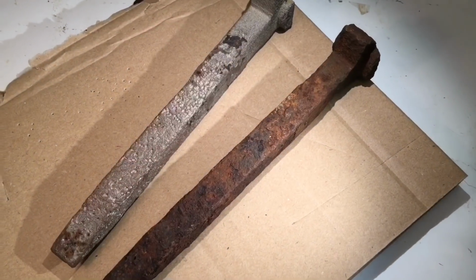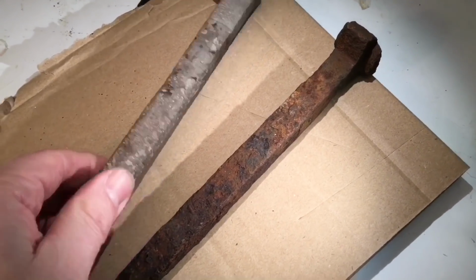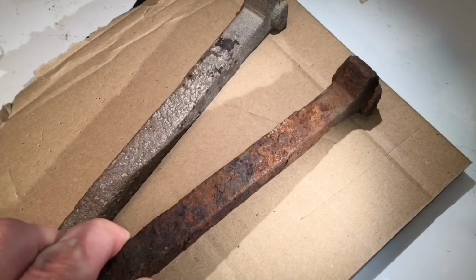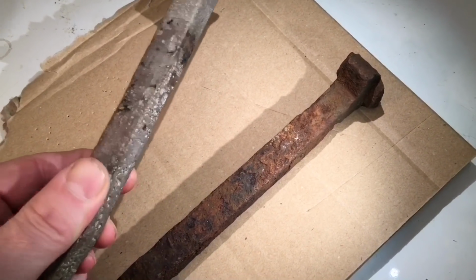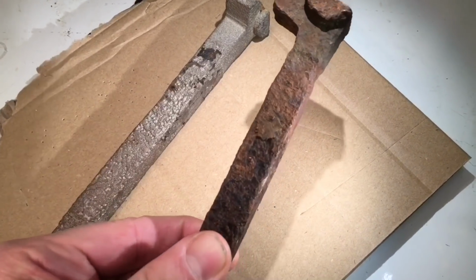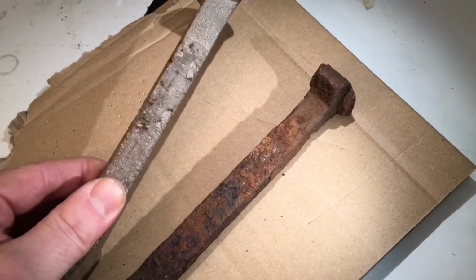So to evaluate our experiment, I have these railway nails, and here you can see one which I already removed the rust on, and here's another one which will be used in today's experiment. By measuring the thickness of this one, taken at the same place and having been sitting in the ground for about 20 years, I can tell that there's about 1 millimeter of heavy rust until you get down to the pure iron underneath.